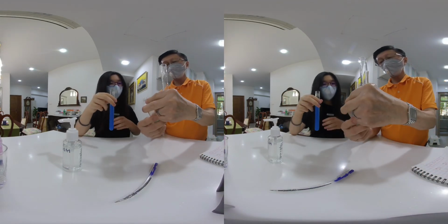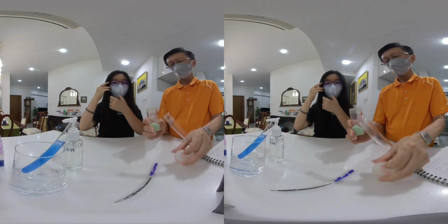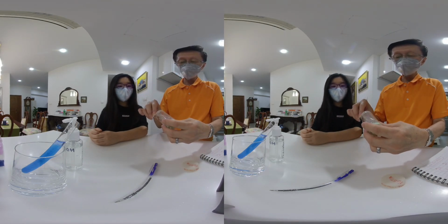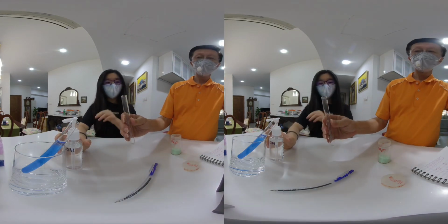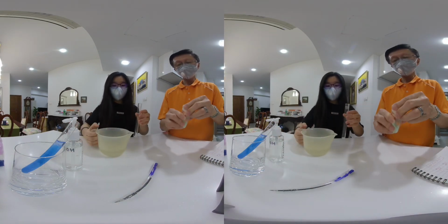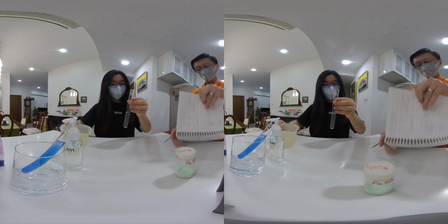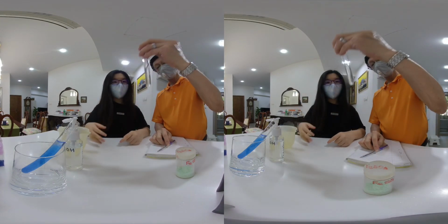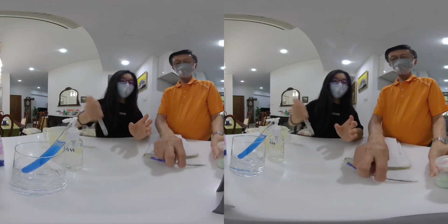We take a little bit of iron 2 sulfate, dissolve in water.